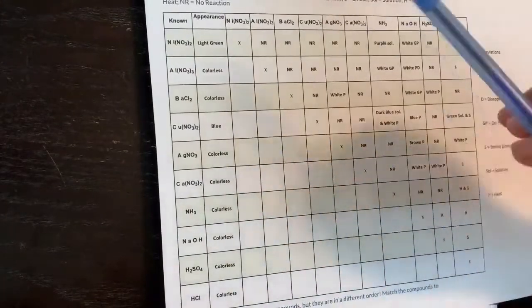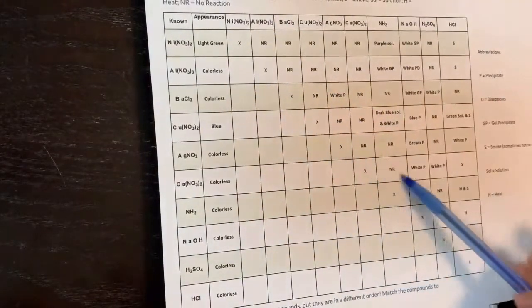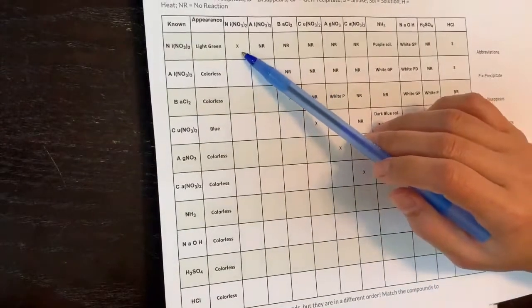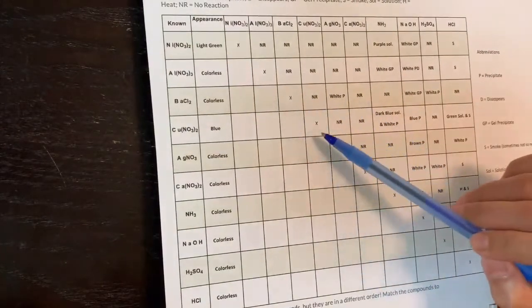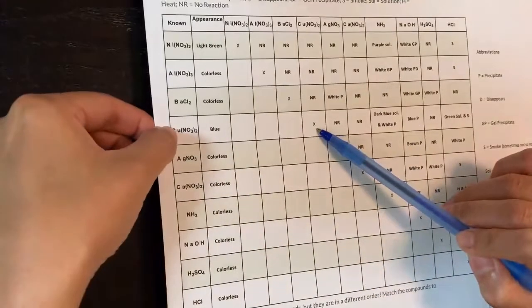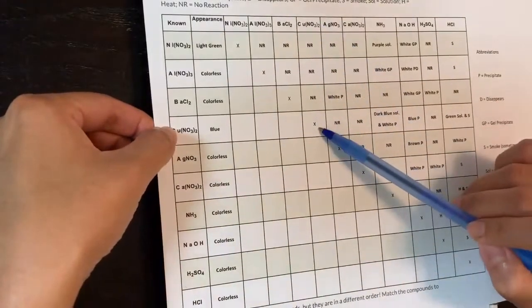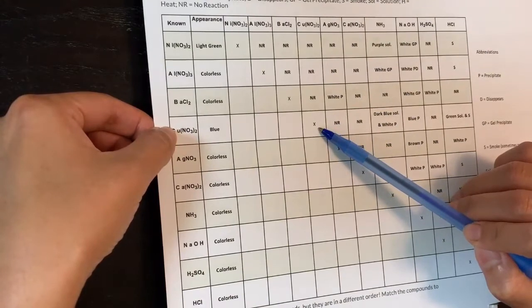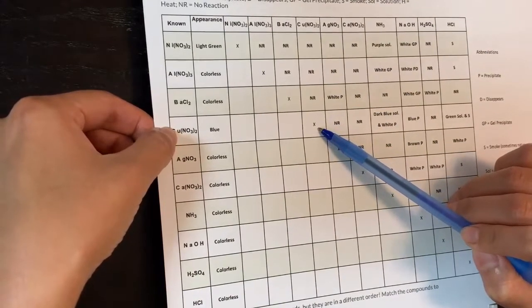There are X's on the table — for example, nickel-nickel, aluminum-aluminum, barium-barium, copper-copper. These X's mean you don't have to do that reaction because you're mixing the same chemical with itself, so there will be no reaction.